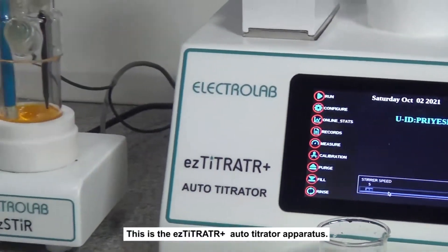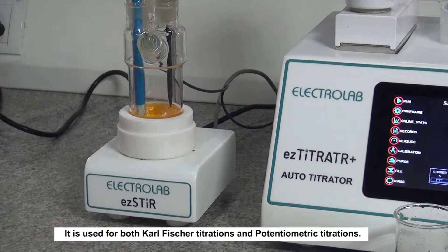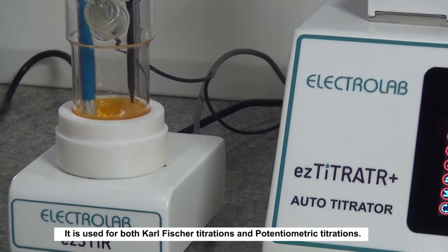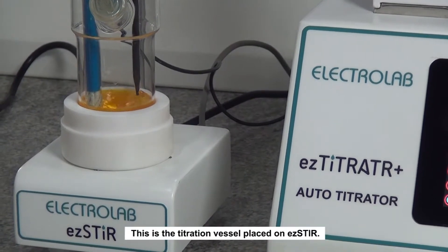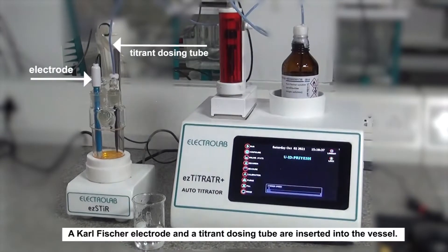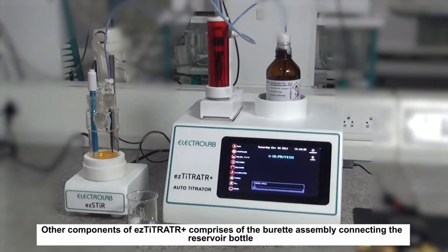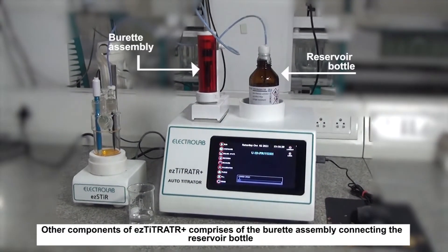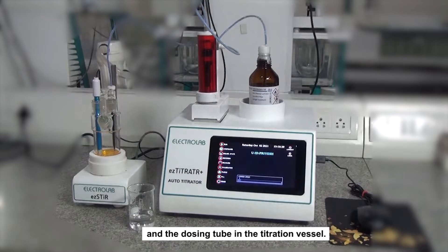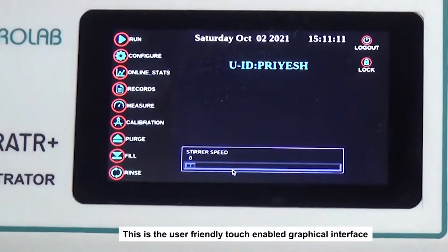This is the Easy Titrator Plus auto titrator apparatus, used for both Karl Fischer titrations and potentiometric titrations. This is the titration vessel placed on the easy stirrer; a Karl Fischer electrode and a titrant dosing tube are inserted into the vessel. Other components include the burette assembly connecting the reservoir bottle and the dosing tube in the titration vessel. This is the user-friendly touch-enabled graphical interface.